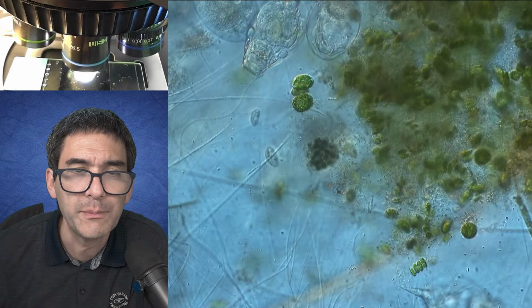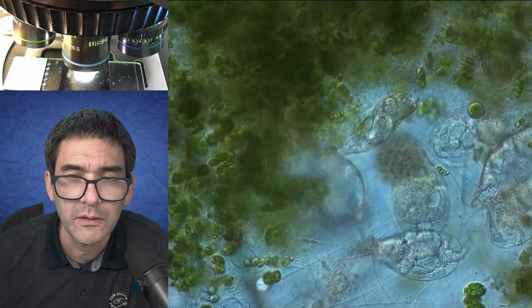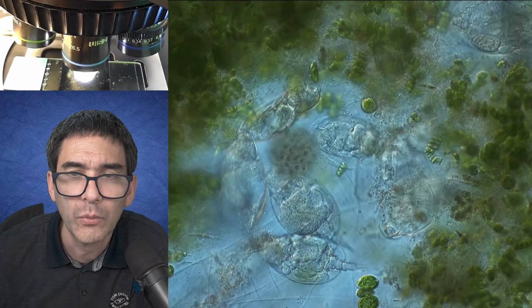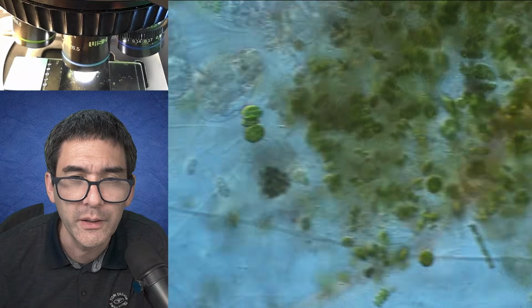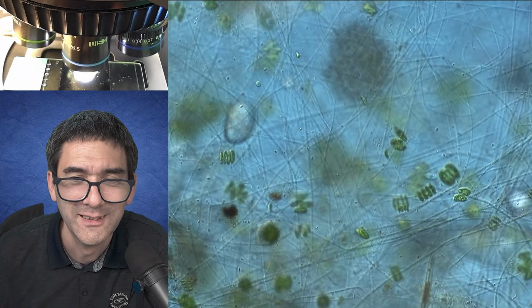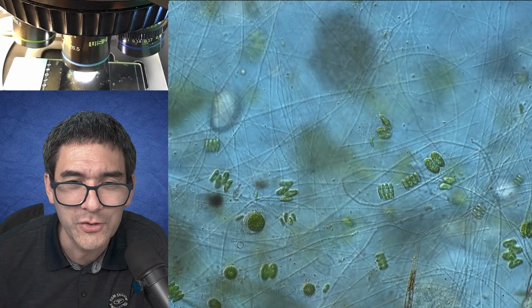Those fine lines that you see in the background are most likely cyanobacteria, obviously. And here they are all cramped together, having a more or less happy life, not knowing that they're now being watched by, I don't know, how many people? A lot of people. They have other things to worry about. Again, the algae over here.